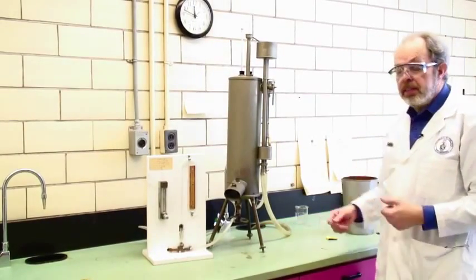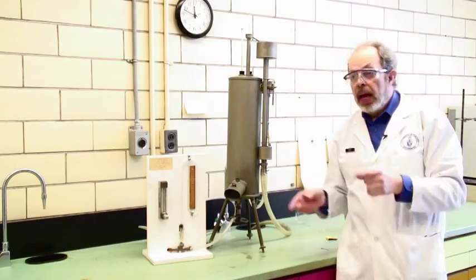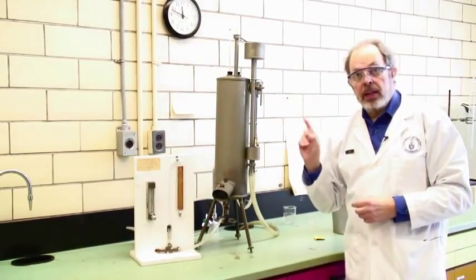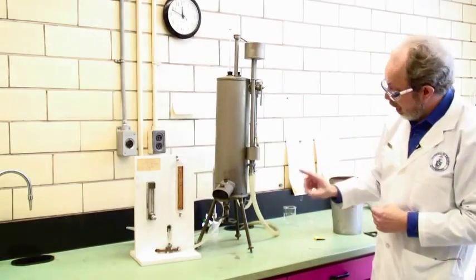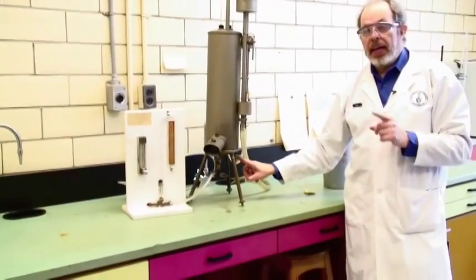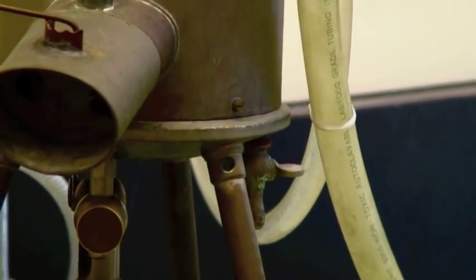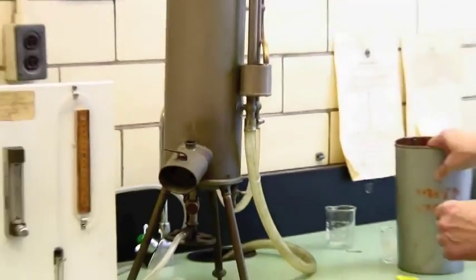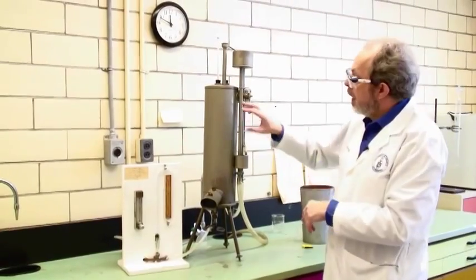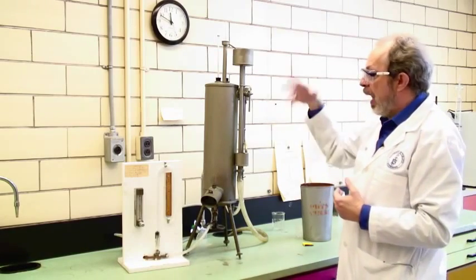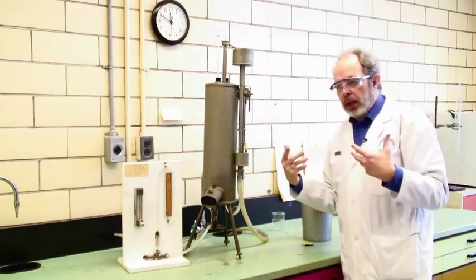As natural gas burns, it produces CO2, which is a gas of course, and it produces water. The water at the temperature of the cooling jacket is a liquid and so it will start to condense. It takes a while for this to happen. This nozzle here, not the one with a tap on it, but the open nozzle here is where the condensate will start to drip out. Until you have dripping from this nozzle, there's no point in taking any readings. As I said, it takes about 10 minutes. Once you have got this equilibrated and the temperatures up here are stable, the incoming water will probably be around about 4 or 5 degrees. The outgoing one will be warmer than that. It's time to start measuring.